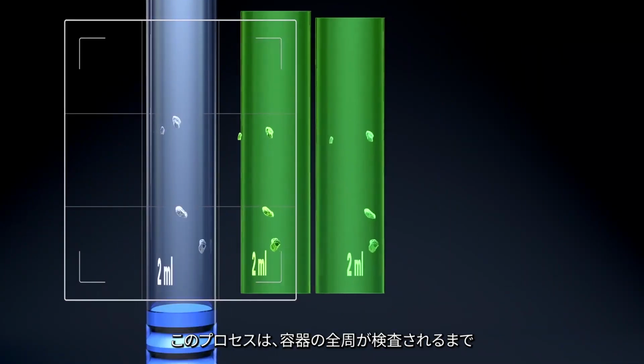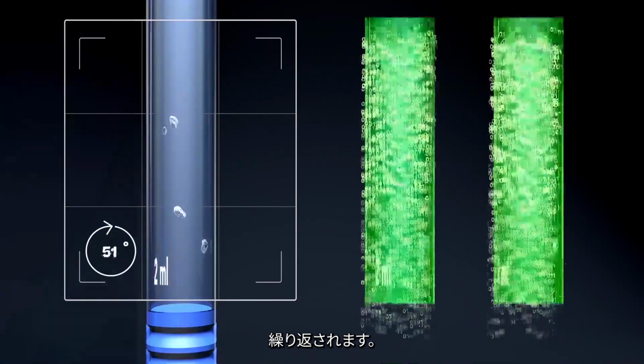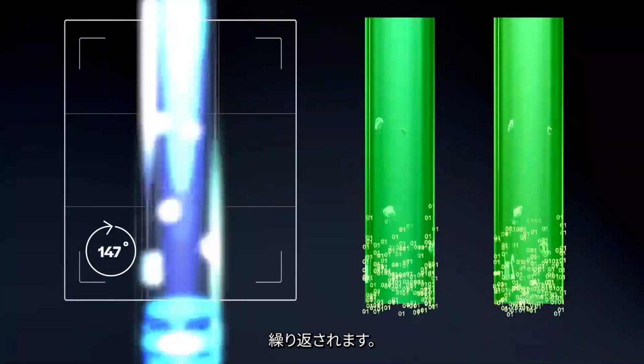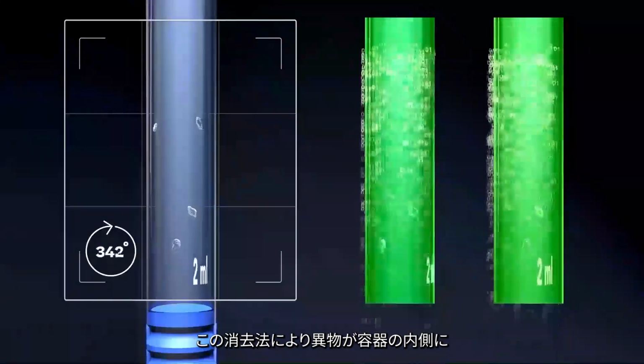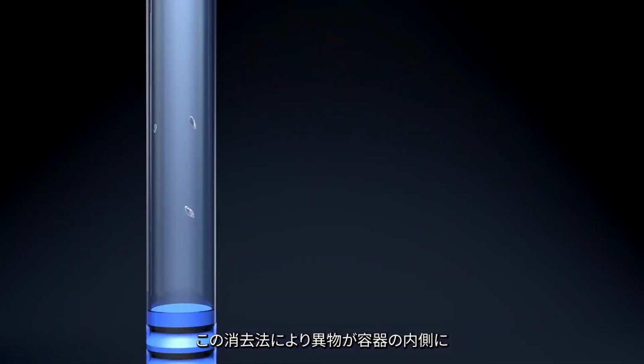This process is repeated until the entire circumference of the container has been inspected. In the final image, only unmasked particles are shown, which have been identified by the process of elimination as being clearly located inside the container.